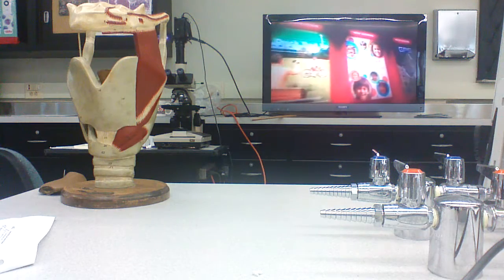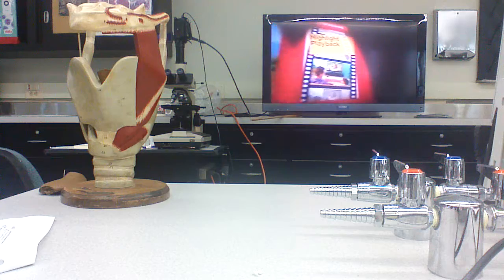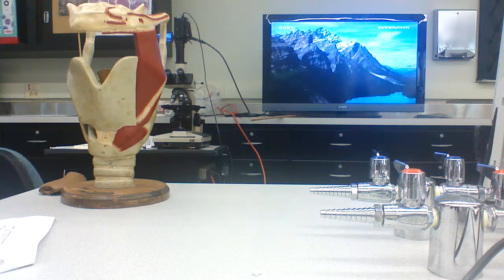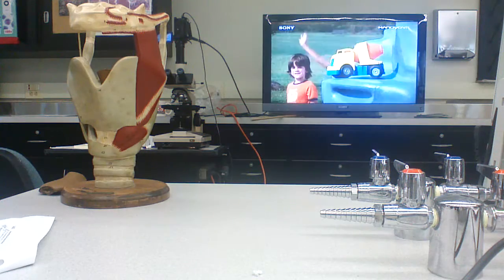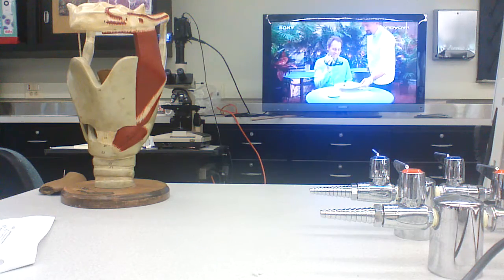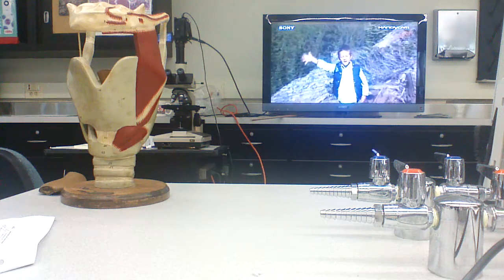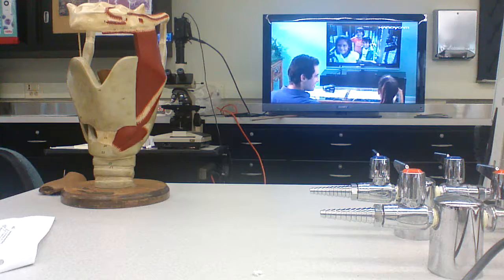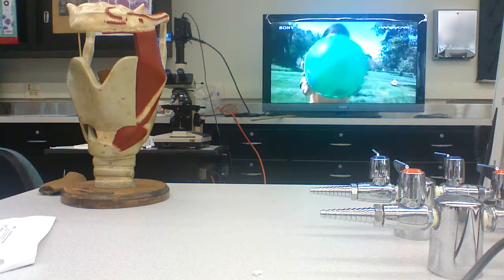Very dense, very shiny. You can polish yourself with it. The other stuff in here, not so much. It seems to be made out of myriad little plates or trabeculae, and that's called trabecular or spongy bone. So those are the two kinds of bone that you have.